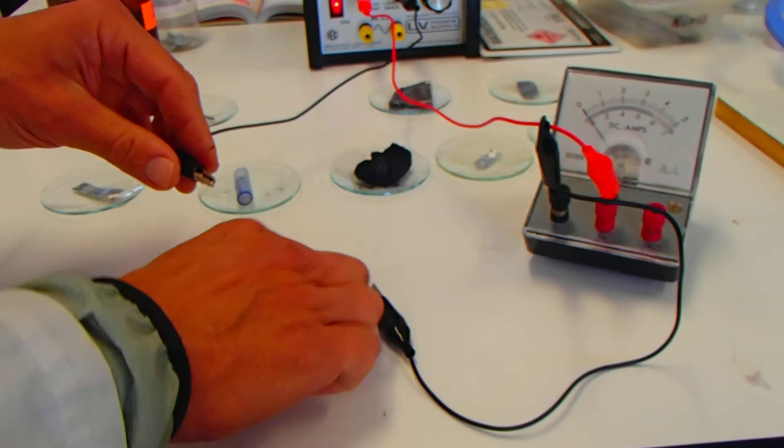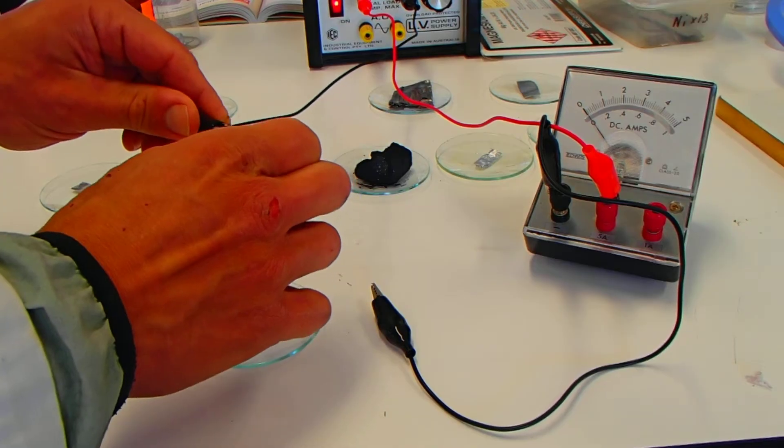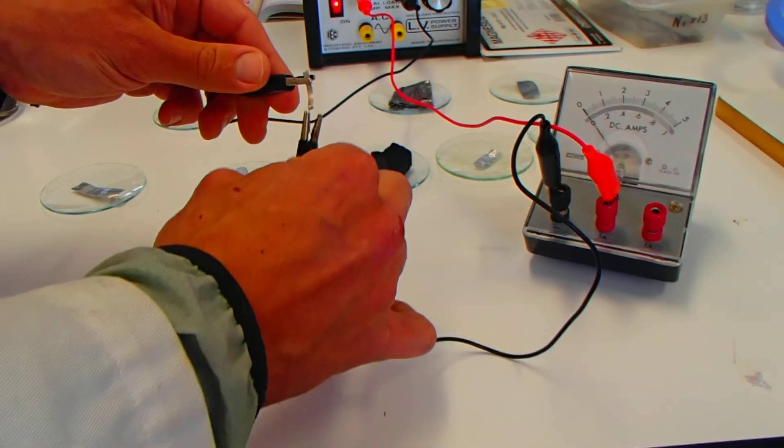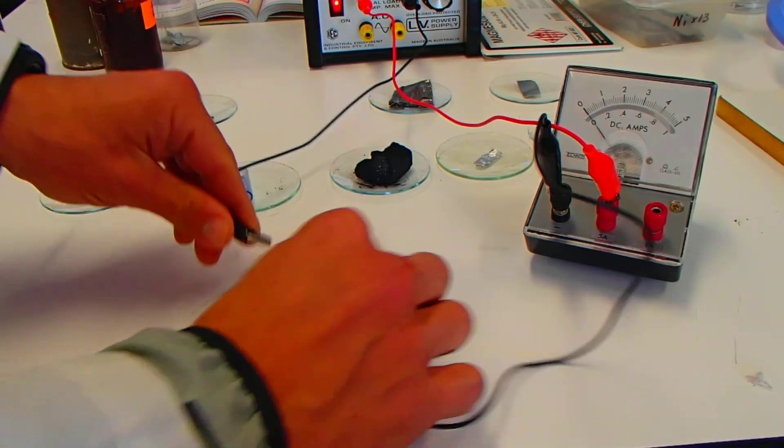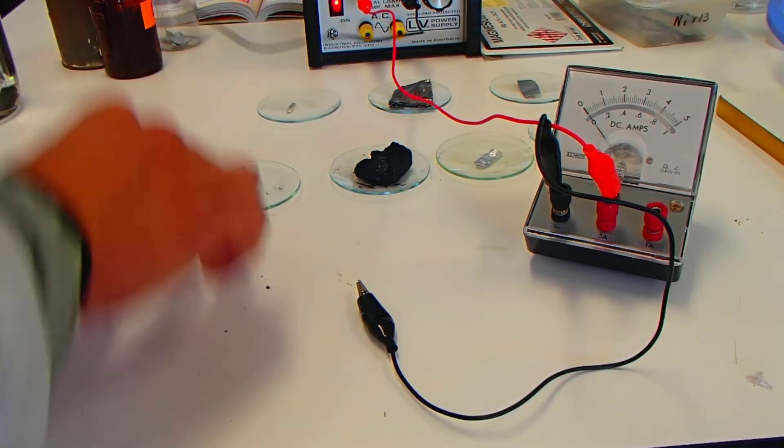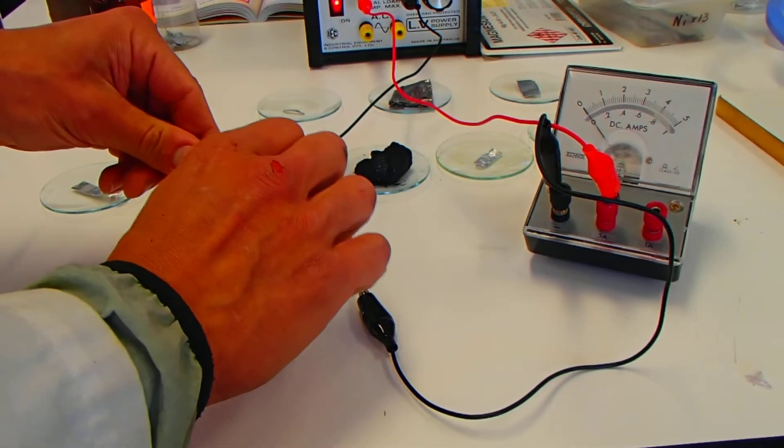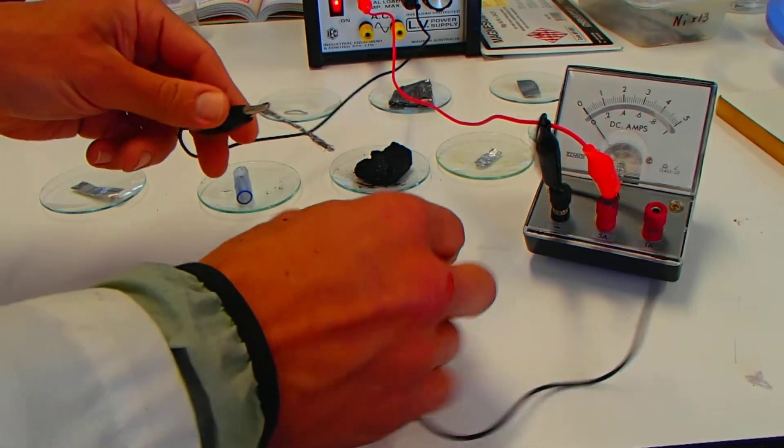Magnesium. Pop one there. And pop one there. Yes. Again. These shiny samples all seemingly carry electricity, carry the current.